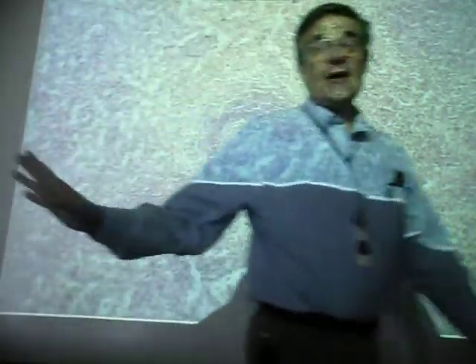Any other questions on this? All right, let's look at another lymphatic organ. That's the thymus.